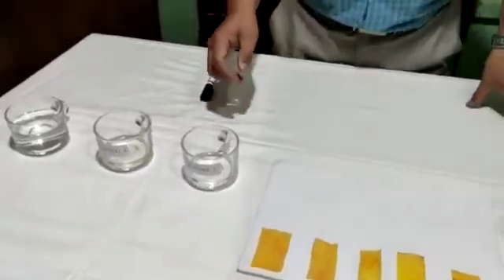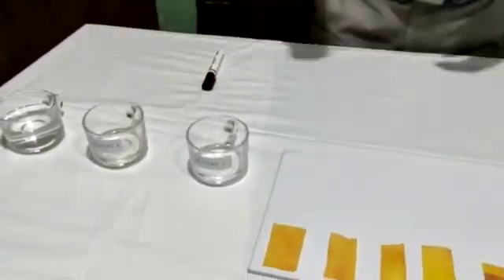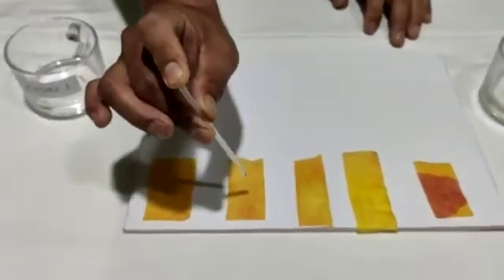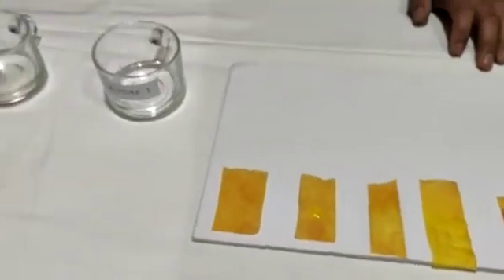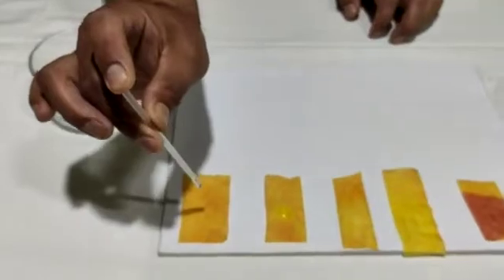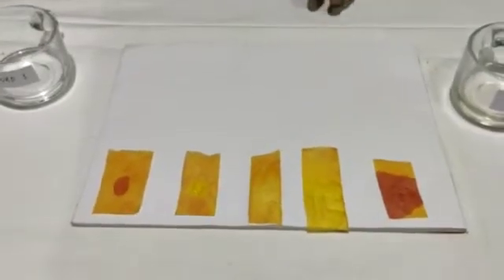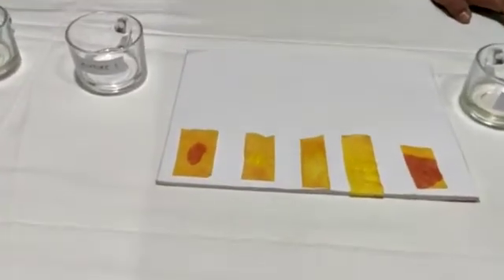Now we have finished making two different mixtures — mixture 1 and mixture 2. This time, we need to take one drop from mixture 1 and put it on this turmeric indicator. Now we need to take one more drop from mixture 2 and put it here on this turmeric indicator. Let us see what is going to happen on these two turmeric indicators.